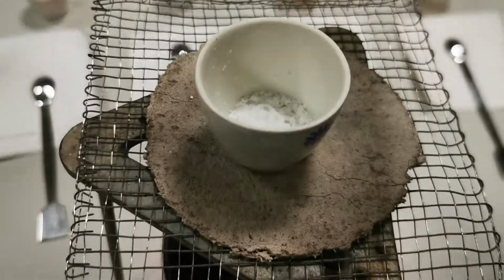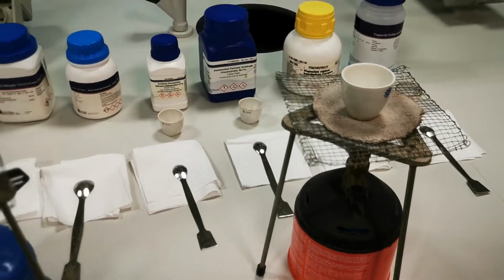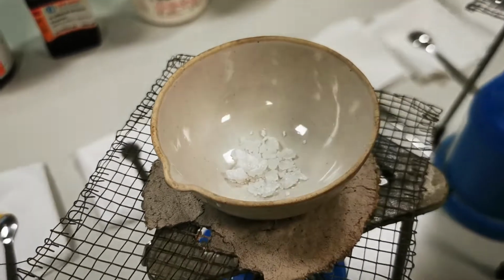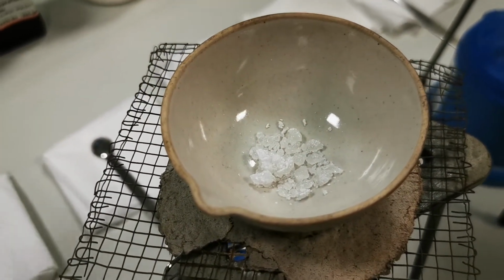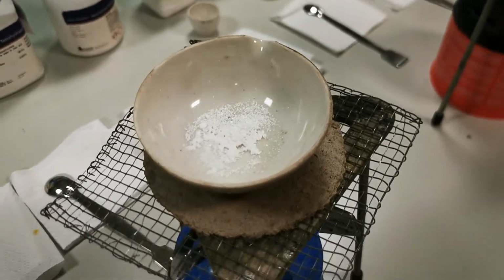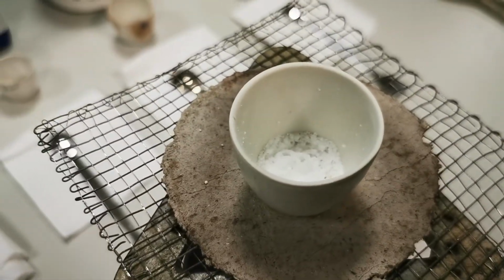So that's it basically. These are the steps of the hydrate chemical experiment. So you just have to take the hydrate, heat it up, remove the water molecules from it, measure the mass before and after, and the difference would be the mass of the water that evaporated. And then you will do your calculations in order to determine the formula of the unknown hydrate.